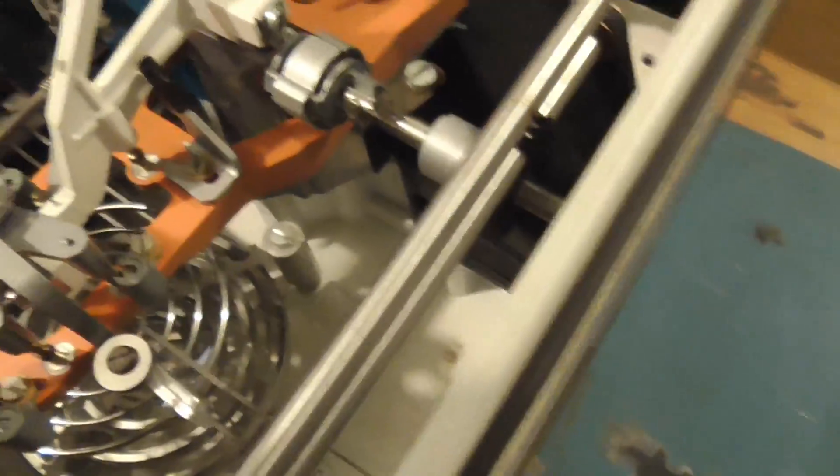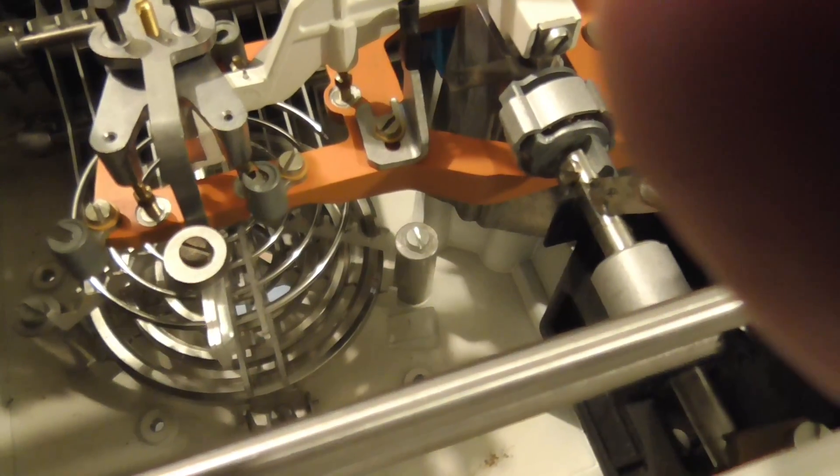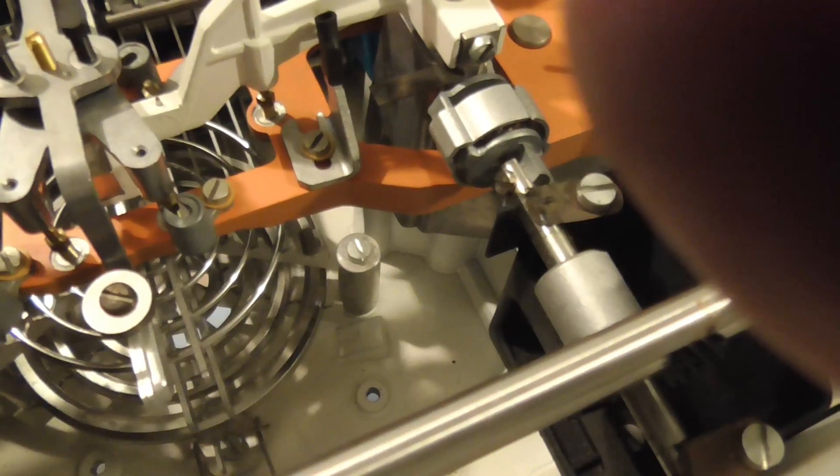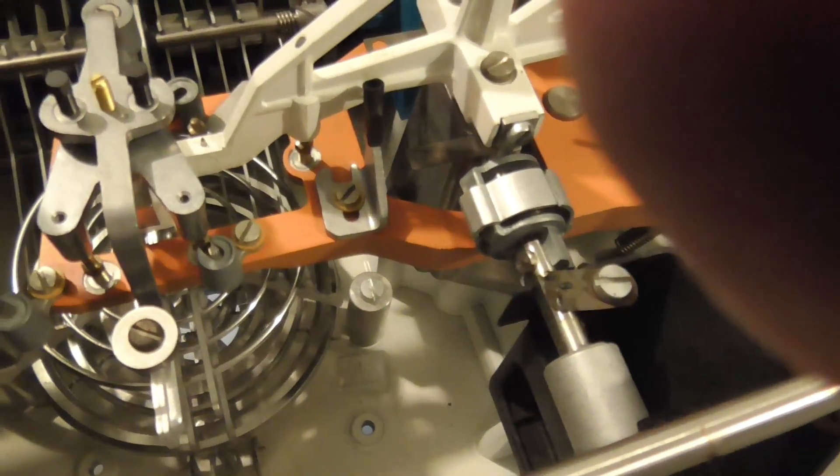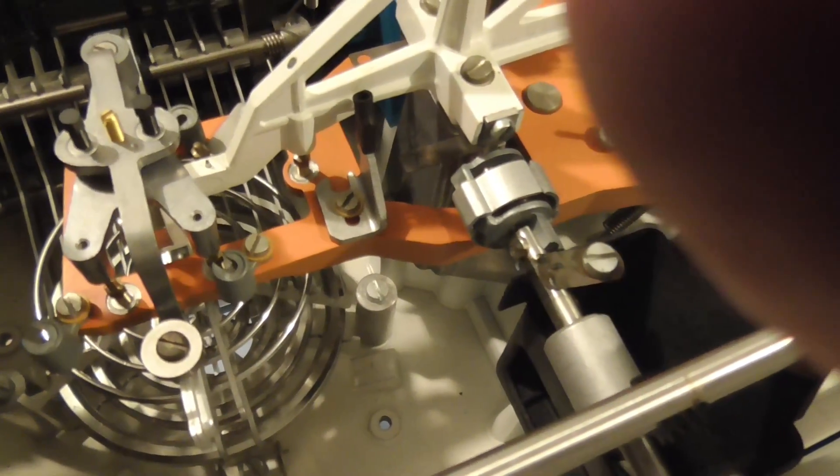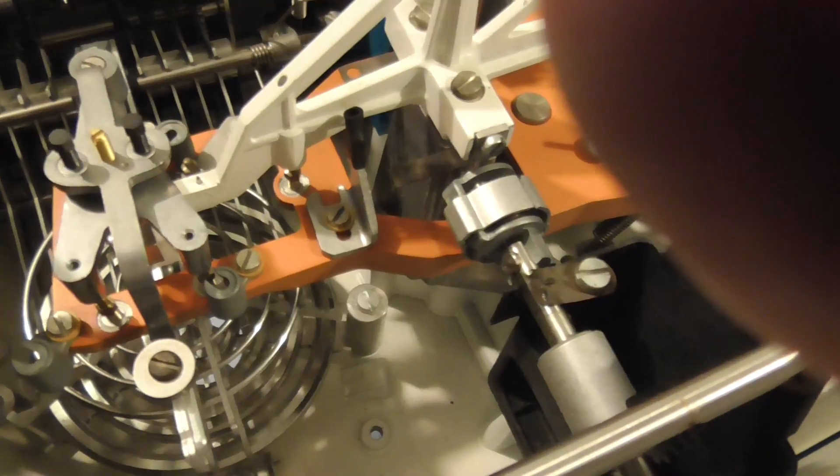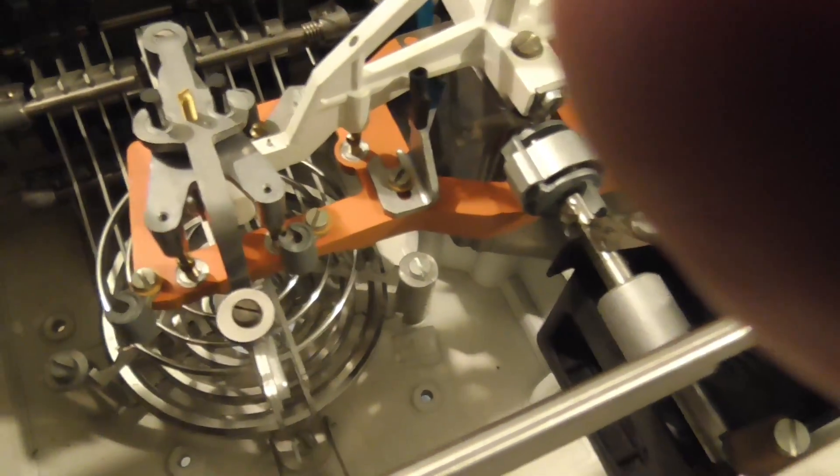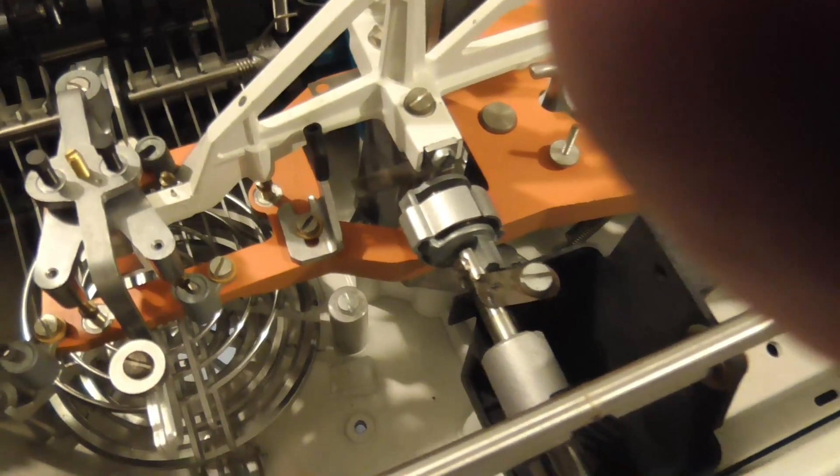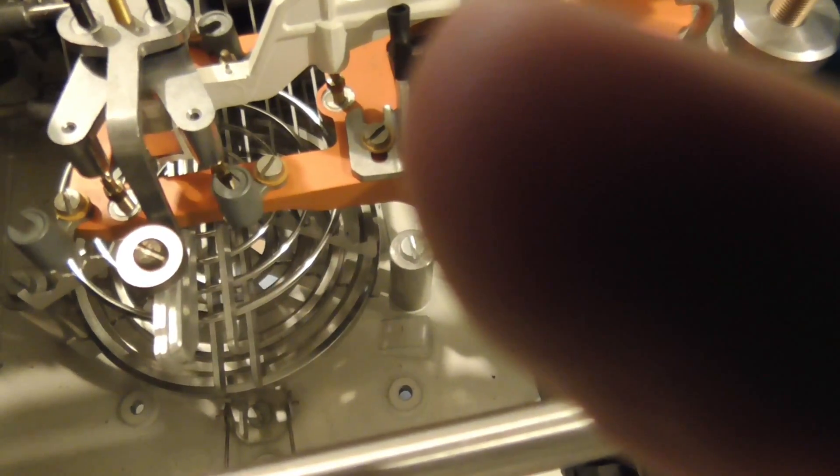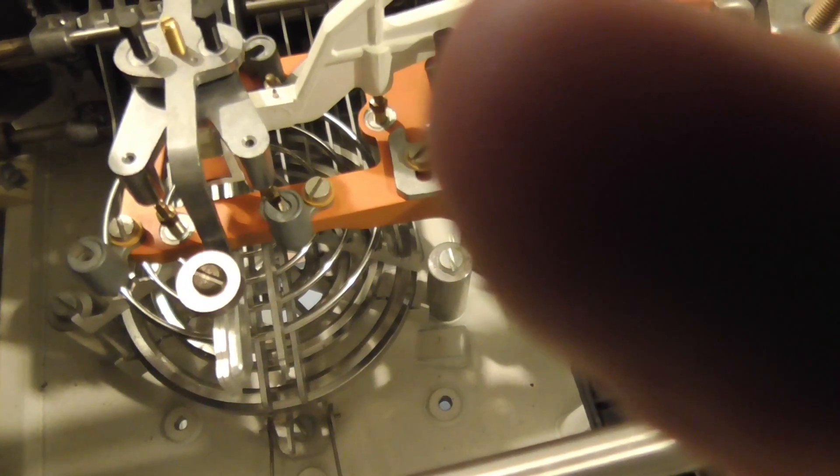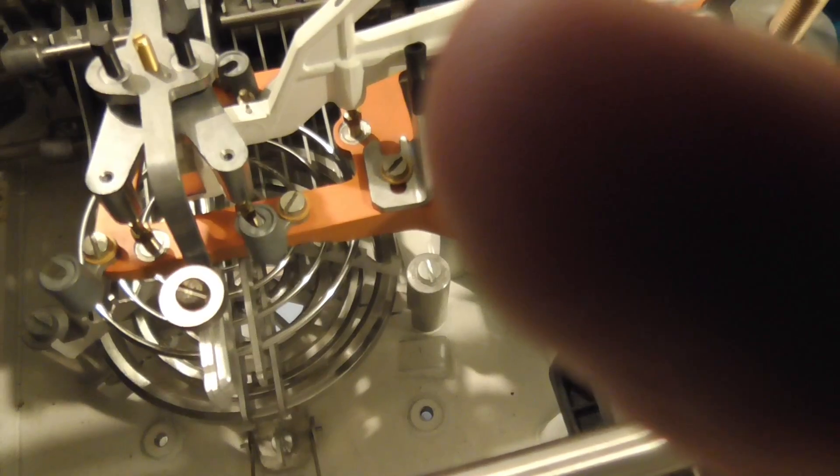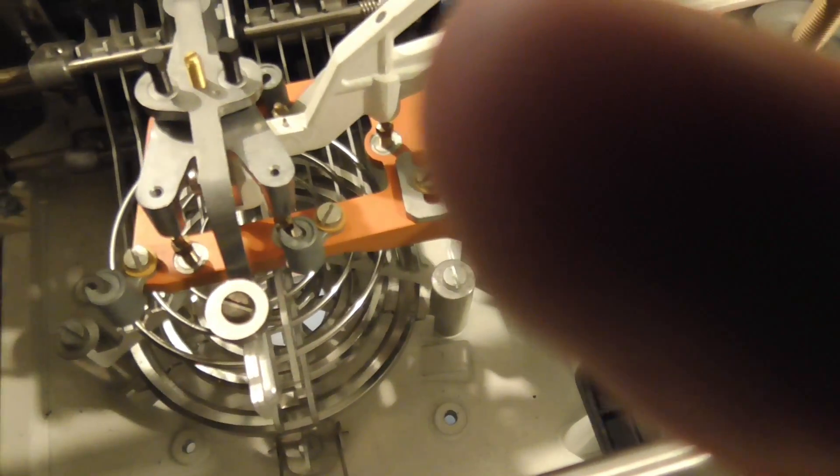You see down inside here, you see those rings? Those rings mechanically are lifted and set onto the balance in order to change the scale. It's just like if you took a plain old balance that uses separate weights. You have a pan on one side where you put the weights, and on the other side, you put your sample. And this works exactly the same way. It's ridiculously complicated mechanically. And when you change this, you can see those rings in there going up and down as I change the sensitivity, adding the weights to go ahead and cancel out whatever's on the tray.